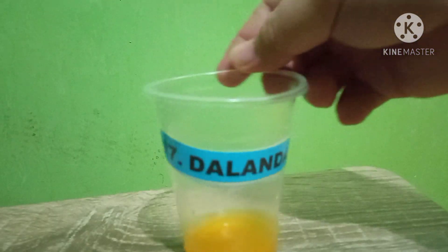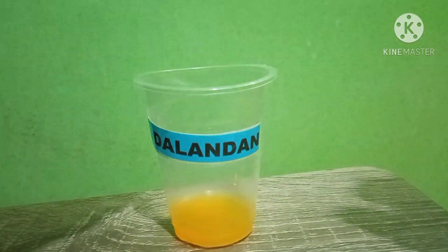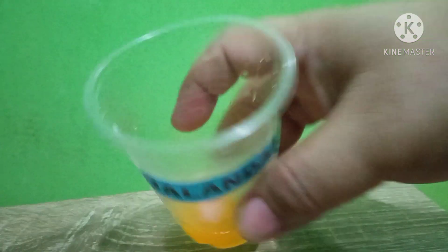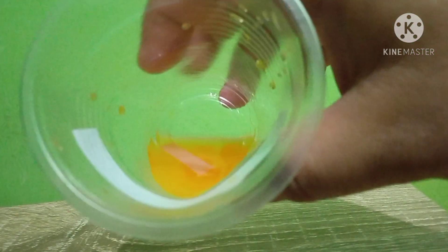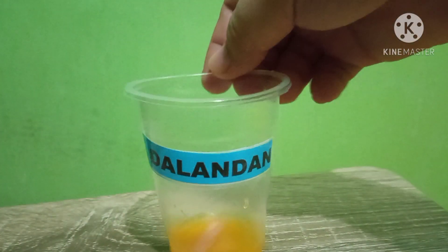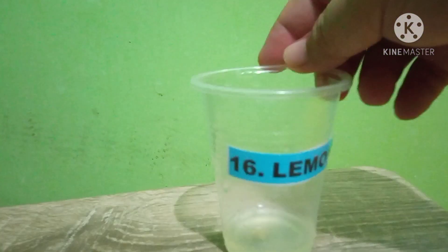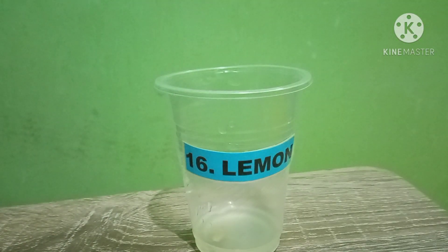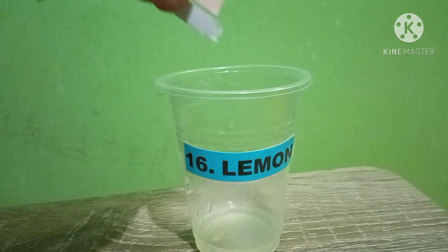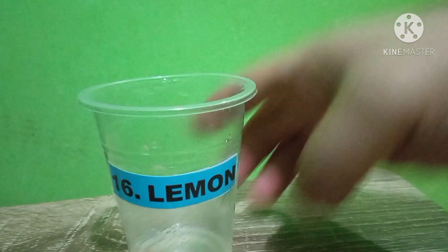Next is Dalandan (orange). Let's check — both turned red. So dalandan is an acid. Next is Lemon — both turned red as well. Lemon is an acid.